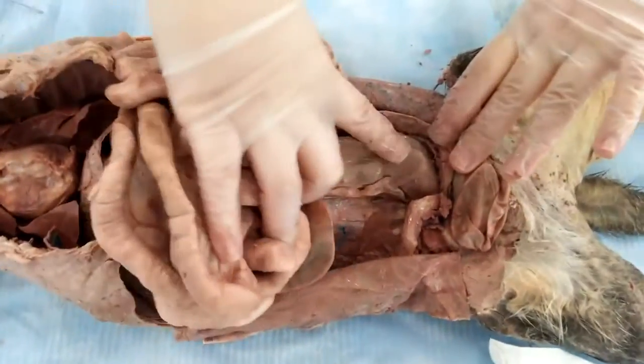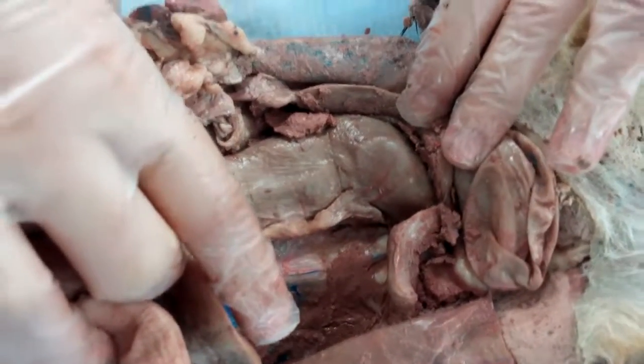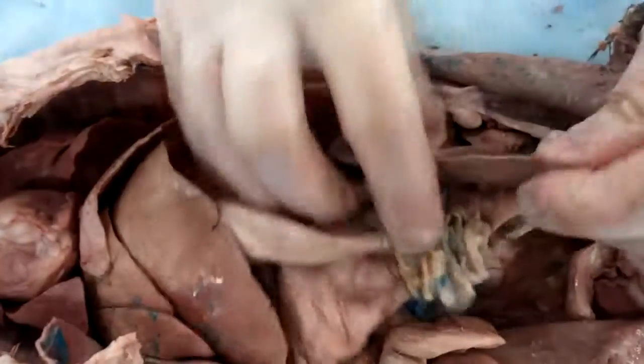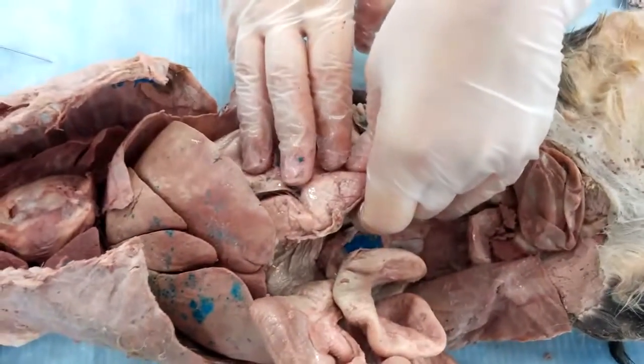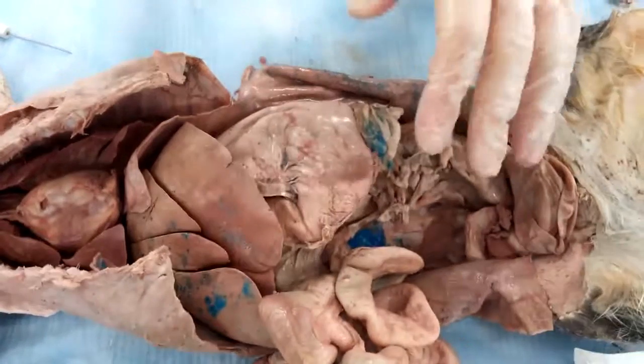And then, if you move it out, if you see this little bit right here, that is the rectum. And now we're going to move on. We have the spleen over here, right here. Our stomach is right here — this big thing right here. I think that's it.